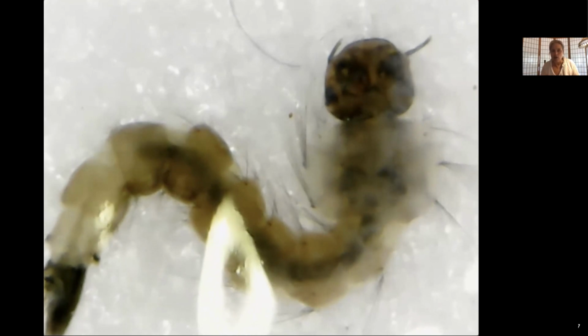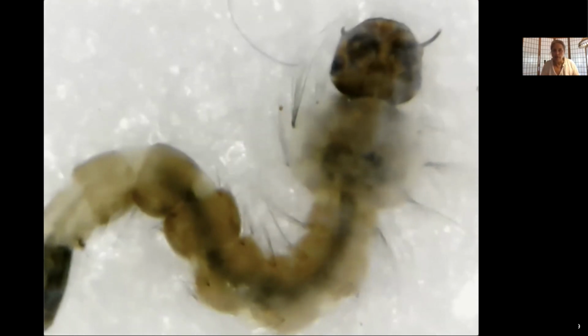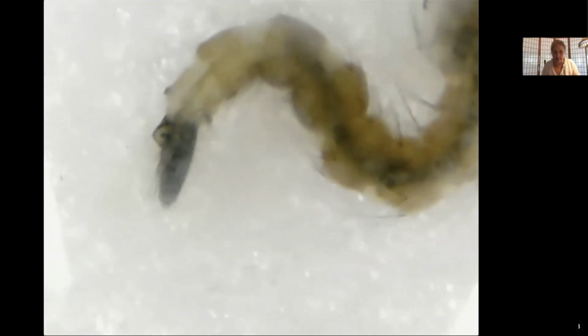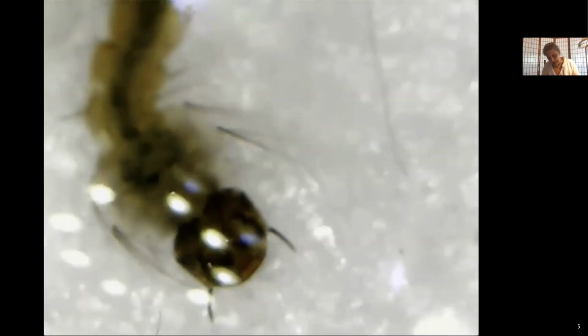It is now moving very slowly. And now let's take a look at all these different parts. So when we're looking at the key, the first thing we're going to do is take a look at the siphon, and we're going to try and describe that siphon according to the steps in the key. The first step in the key asks us to look at the siphon and determine whether it is very sharp, like for piercing plant tissue, or if it is blunt, or if it is long and cylindrical.